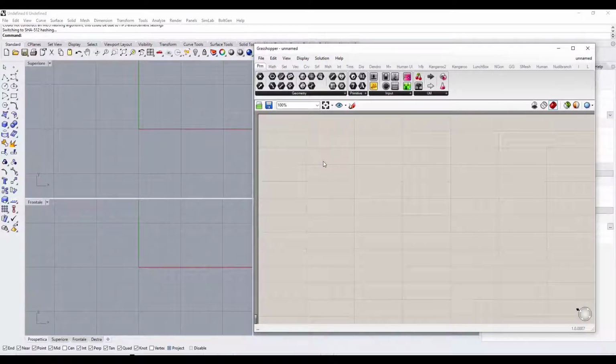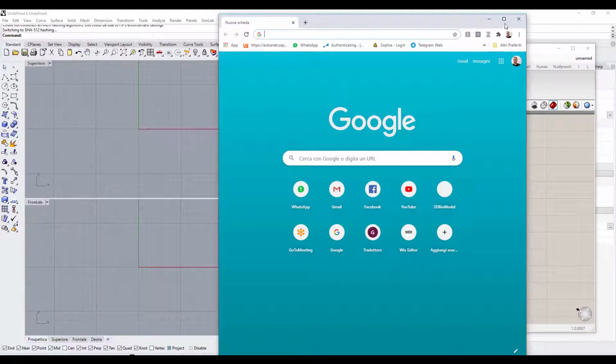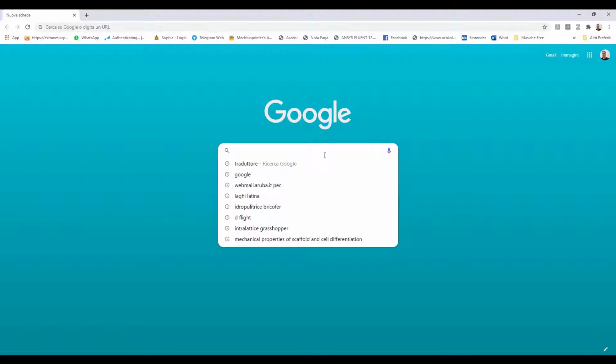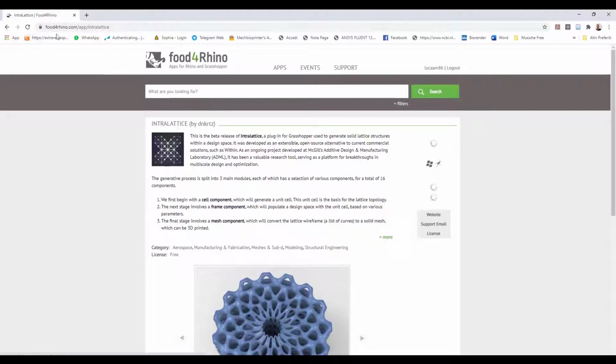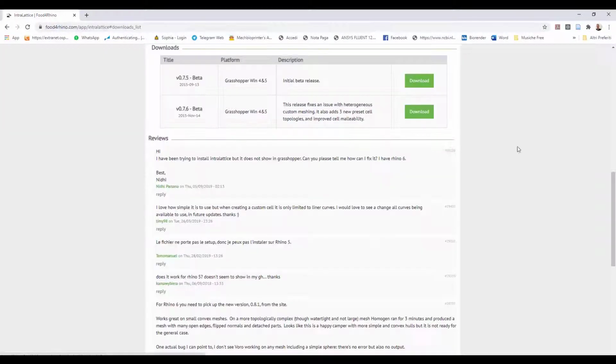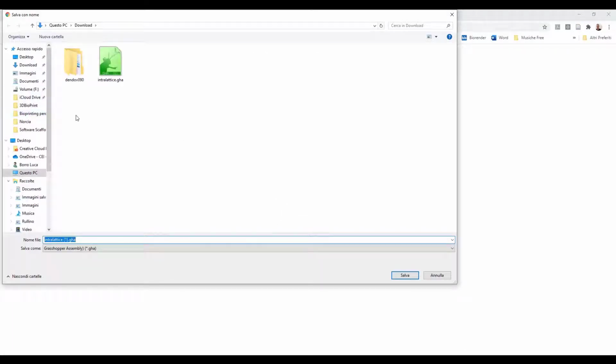But before we begin drawing the scaffold, we need to install two free Grasshopper components. The first component is called IntraLattice, and we can download it for free on Google. So we go to the Google homepage and type in the search bar IntraLattice Grasshopper. Okay, this is the IntraLattice page on the Food4Rhino portal. We click on download and we select the version 0.7.6 beta and download it into our specific folder.